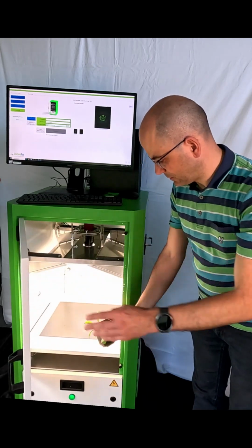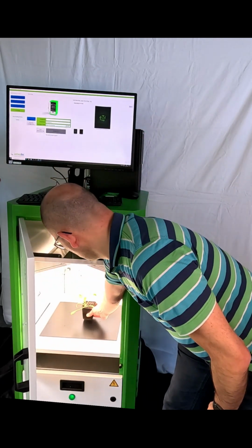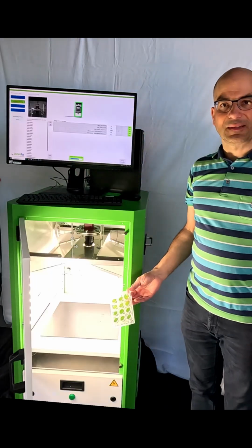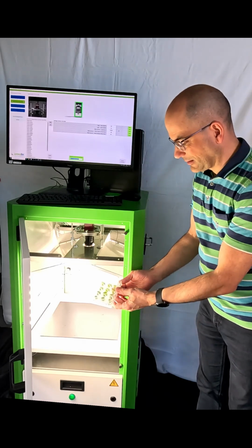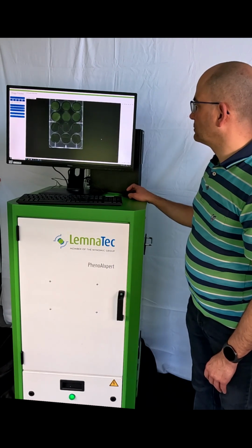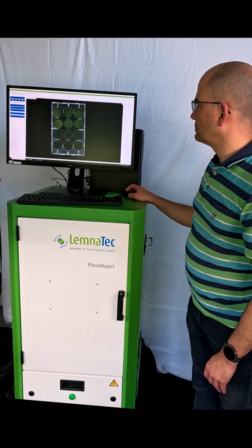The system can not only take Arabidopsis images. For instance, here is a spinach seedling, or an MTP with some leaf discs. All these types of samples can be imaged with the system, and matching recording configurations can be set to get good images. Establishing configurations takes place in a pre-experiment.